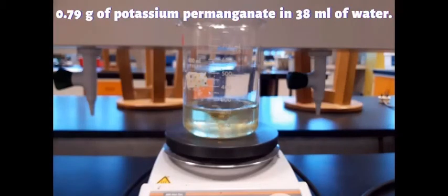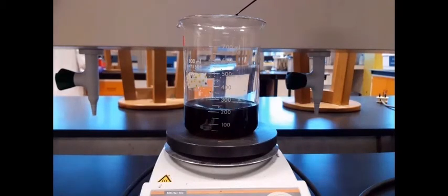A solution of potassium permanganate will be added into the stirring mixture. Before you start the experiment, you have to prepare 0.79 gram of potassium permanganate in around 38 ml of water. Add this solution slowly. We started with manganese 2 chloride, and since we are going to prepare a manganese 3 complex, we need to oxidize manganese 2 to manganese 3.